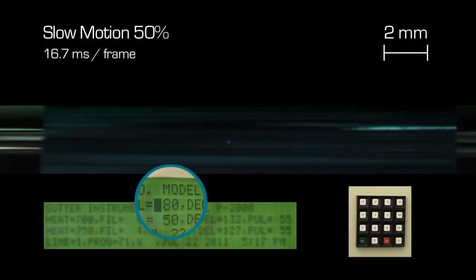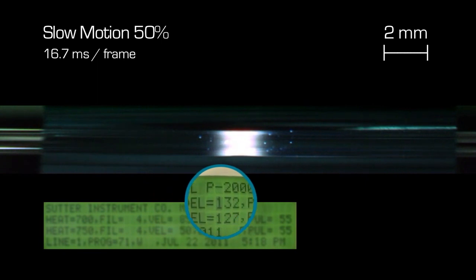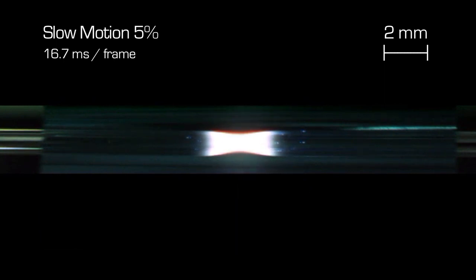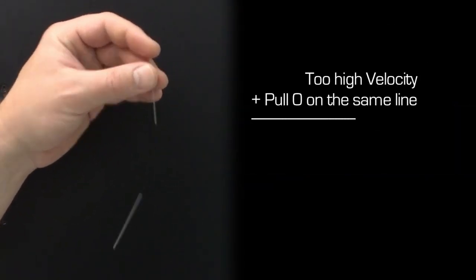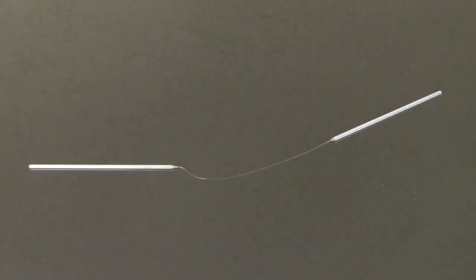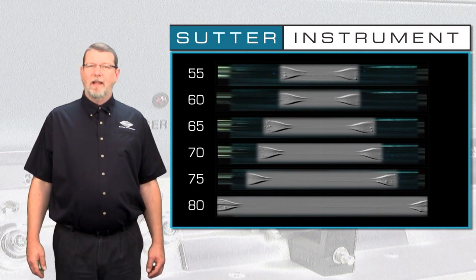You will ask, what happens if you push the velocity even further, in our example to 85 or more? One of two things. If you have a hard pull on the same line, such as the 55 we have in our example, the capillary will draw out far enough to separate on line 1 already. That's what we see here. If you have pull 0 in contrast, which is pretty common for 3, 4 or 5 cycle patch pipette programs, you will often end up with a long wisp and the capillary never separates until the end of travel of the puller bars.